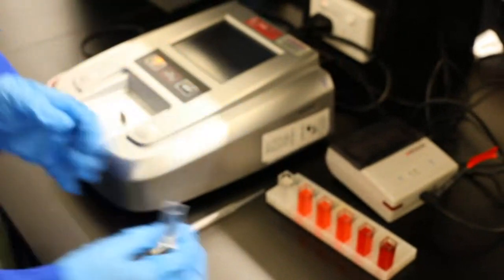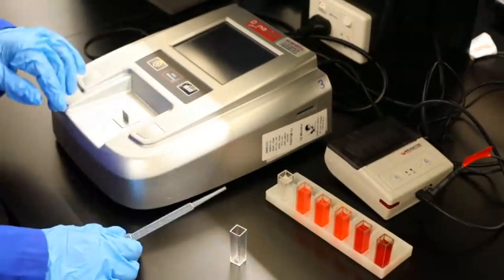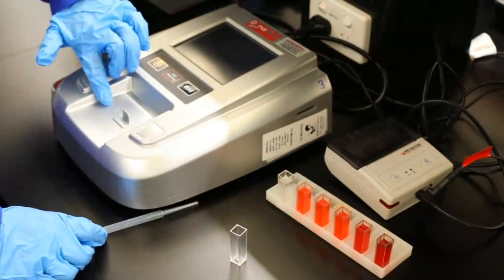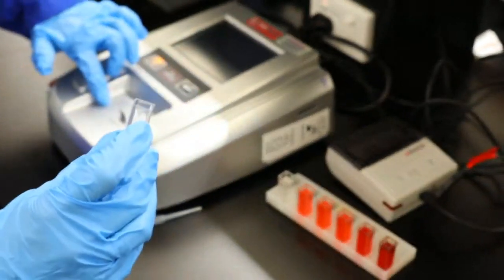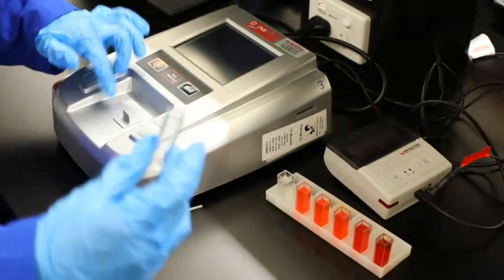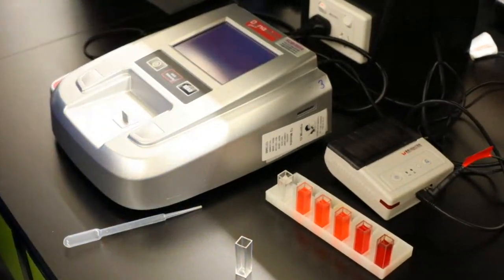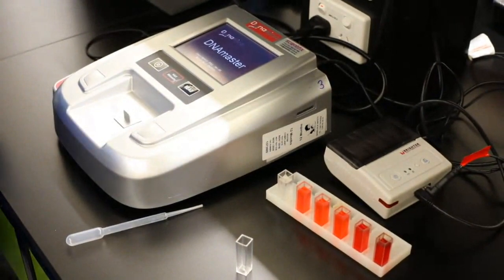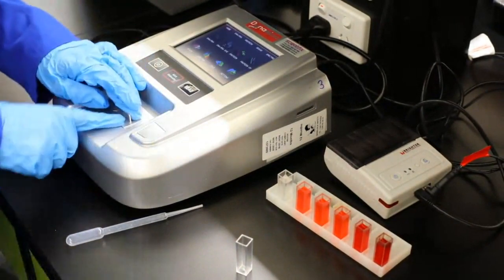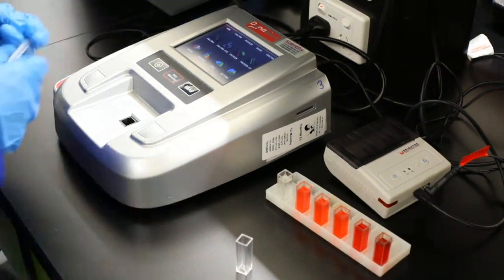So here we have our little machine, and with gloves on I always find it really hard. You have an arrow on here, and that basically is a bit of a hint for you guys to know when you're using it which way you need to put it in. So we turn it on and we have some terrible 80s music. Oh, go ET, he's got the dance on. Here we have our little cover, and simply you can just take that out there.